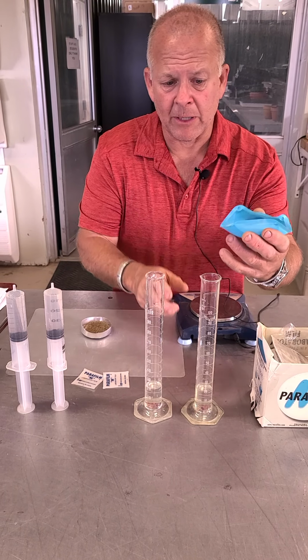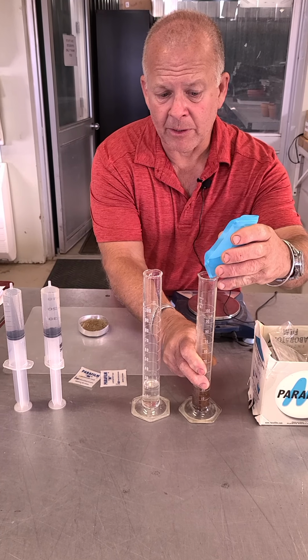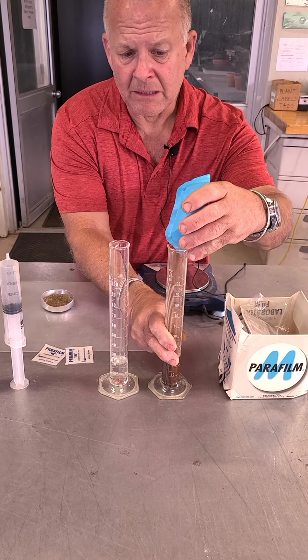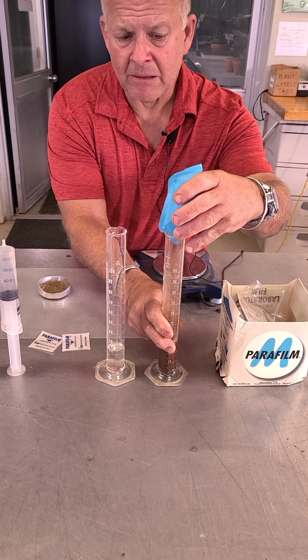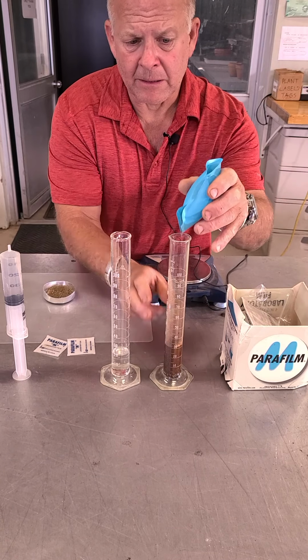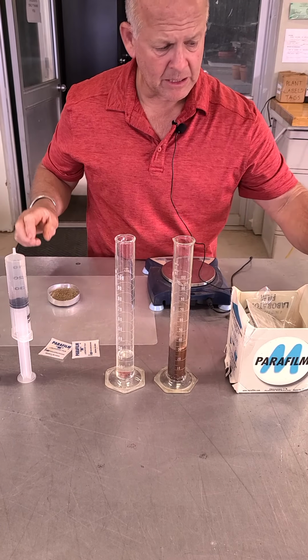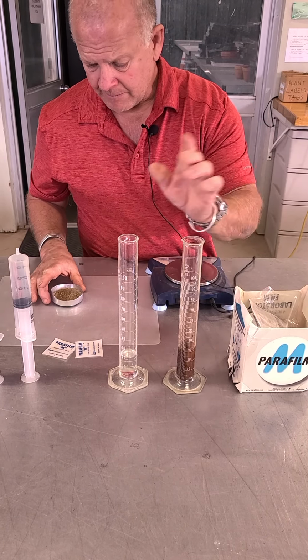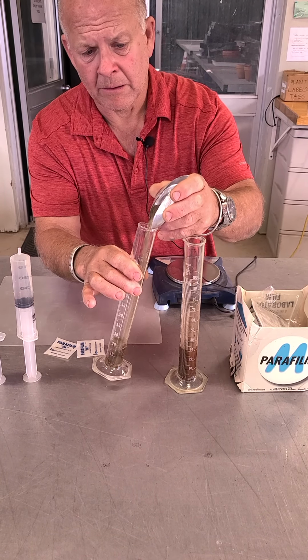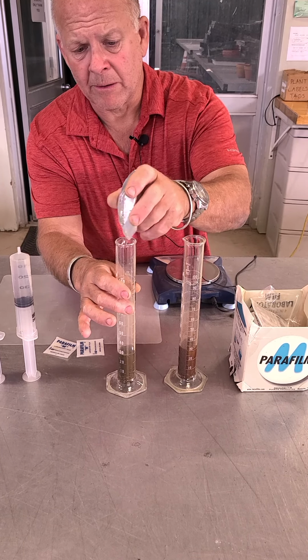If I do this right while I'm on camera, I'm going to pour my 20 grams of soil very carefully into my 20 mils of water. And if I can do it right, I won't get much on the sides, and I won't lose any. All right, so a little tap there for the one millionth of a percent. That's empty. So I've got one there. All right, now I'm going to do the same thing with this one. 20 grams of soil and 20 mils of water.